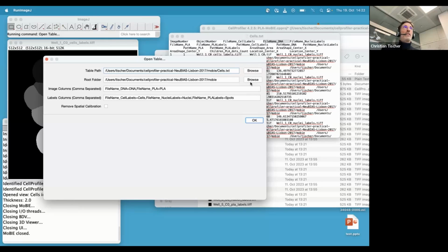Okay. So there is also in CellProfiler another column which is called path name, but that actually doesn't store the whole path, but only the folder. So this makes it a little bit complicated for me. But if you have a use case where you would like to have, for example, your image input data and output data in different folders, which can make a lot of sense, and you really would like to use this plugin, then please write it in the forum thread, and then we can discuss how to implement this. But right now, the limitation is that all the images have to be in the same folder.